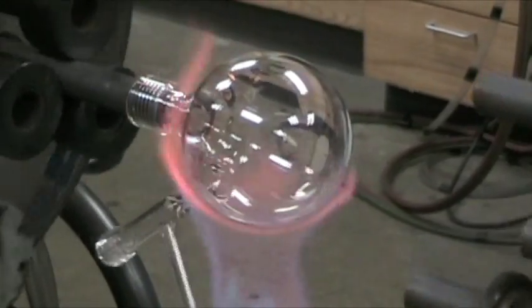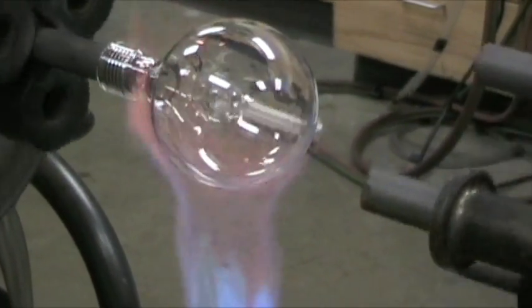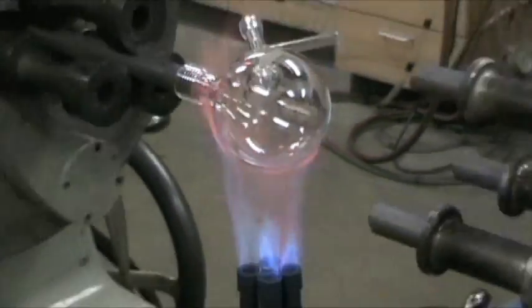See, it's staying pretty much the same all the way around, so I can shut off the flame and not worry about it breaking apart on its own. And that's the end of the flask.